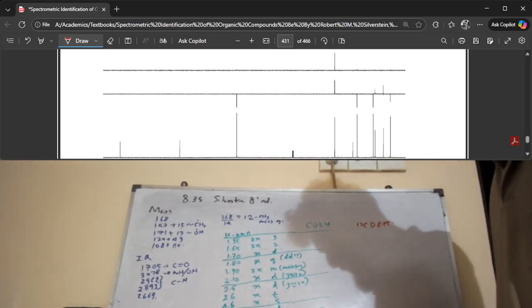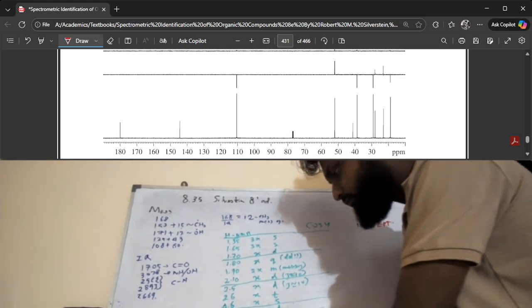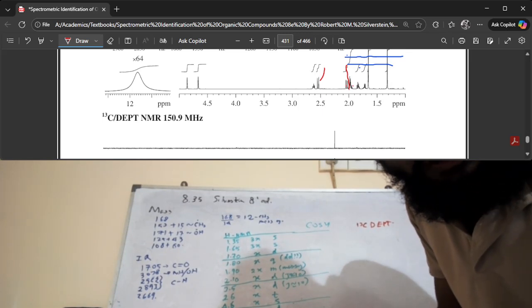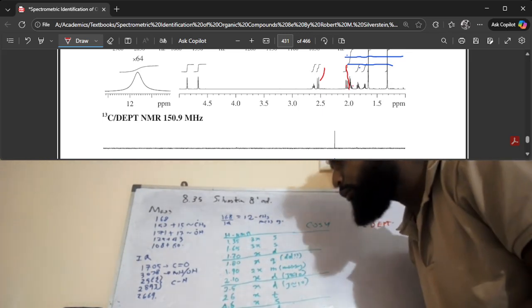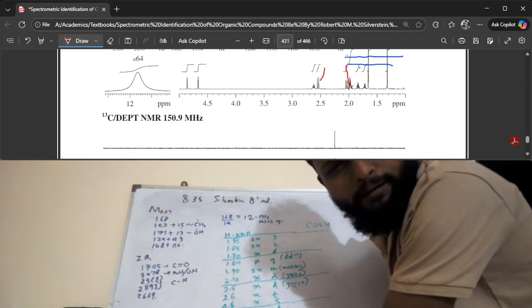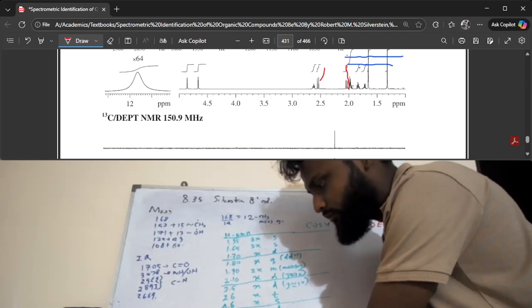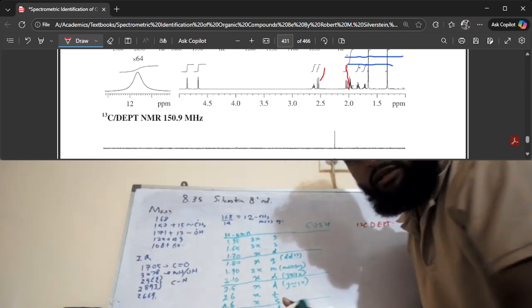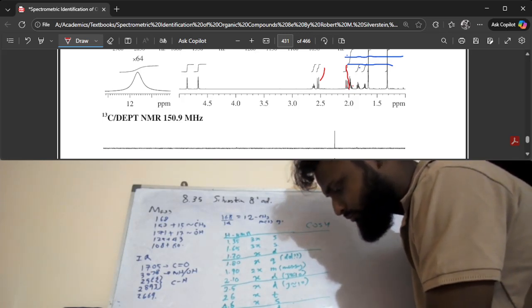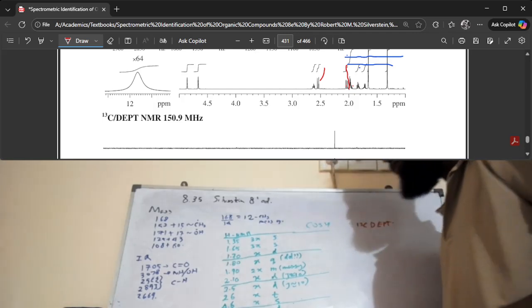All right. So let's look at the graph, right? So, oh, I missed one signal at the bottom here. In the HNMR, there was a signal at 12. This is a very characteristic peak. That probably means that you have a carboxylic acid, right? And the nice thing is that so far, that's not 12.0, maybe 11.9, right? So it's one proton height, the integral, and it's a broad peak. And that is probably the OH proton of the carboxylic group.